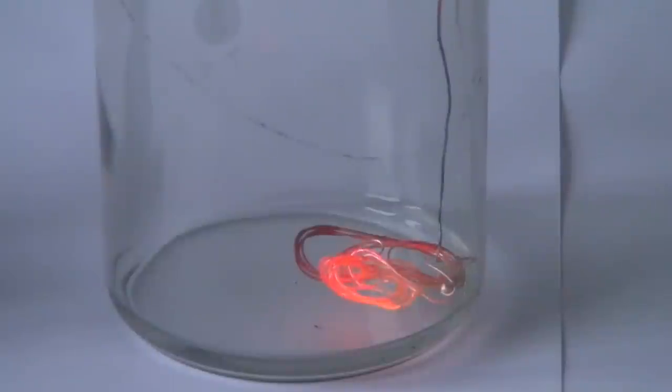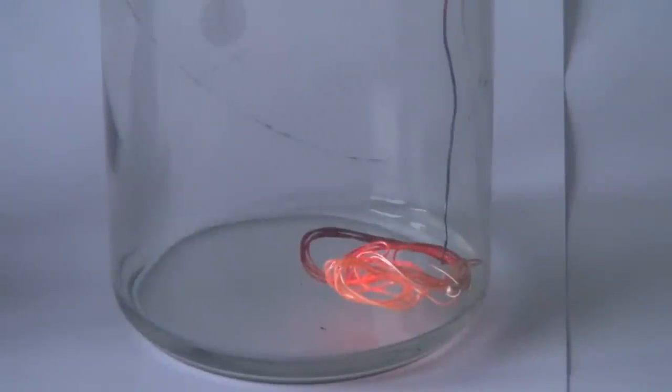Hello everyone, today we will conduct an interesting experiment called acetone flashlight. This experiment consists of acetone vapor oxidation at the surface of copper wire, and the wire heats up and glows. First you will need to get a thin copper wire somewhere.